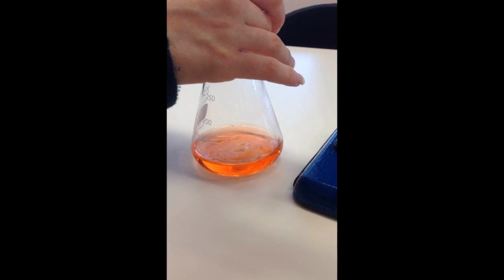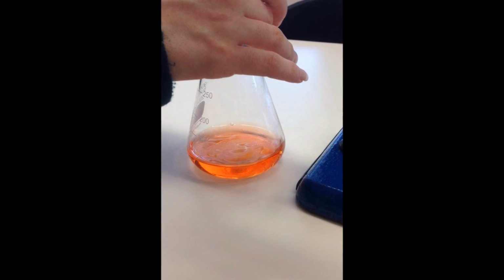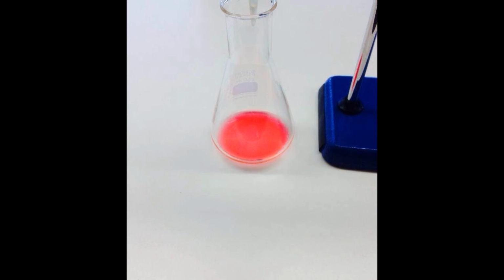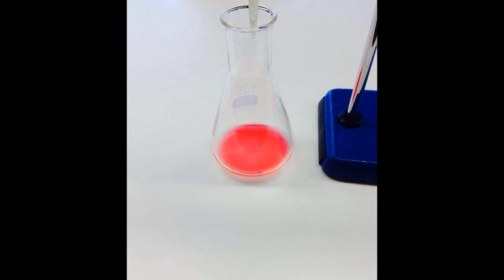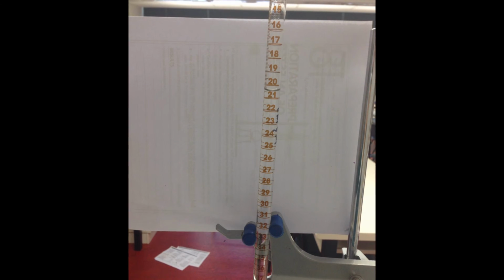Only let individual drops drip, one at a time. Stir the flask with a stirrer or in circles after each drop, as it only takes 1 drop to change the color of the solution. Step 7. Once there has been a noticeable color change, the solution has turned red. Read the volume delivered by the burette as accurately as possible by placing a white piece of paper behind the burette marking lines.